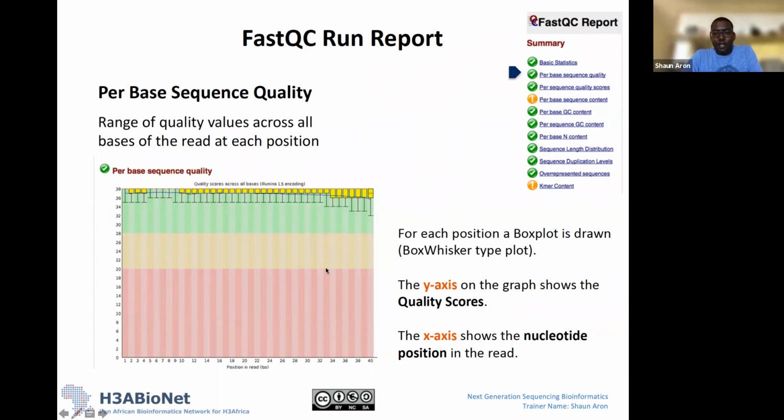Again, for example here at position 32, it seems to be quite consistent that the lowest quality score we see in our data is about 35 at this position. And again, the majority of our quality scores range between 37 and 38 and up.